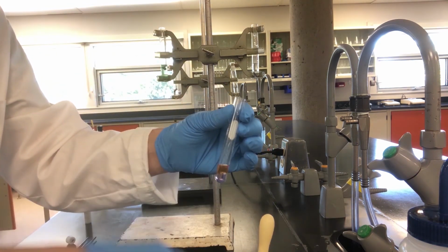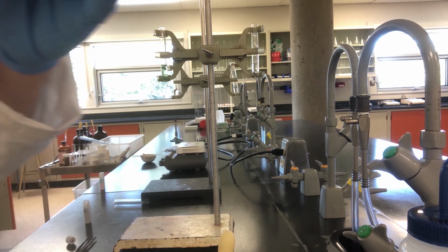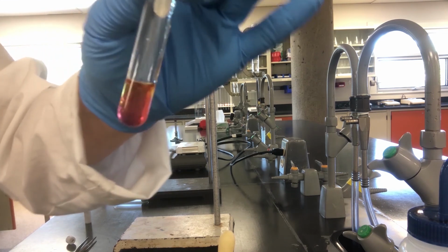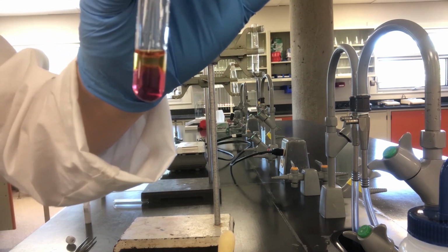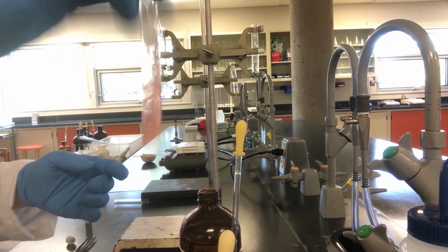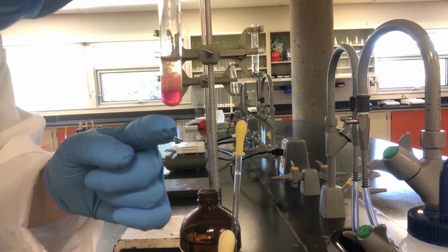First add iodine to the test tube, then dichloromethane. Cap, shake, and notice that the color is that of iodine in dichloromethane. Now, add the reactant, potassium chloride. Cap, then shake. Oh, the color remains the same. What can you conclude? Now you can answer the questions in your lab manual for this part of the experiment. To know the difference between an oxidizing agent, a reducing agent, and what element is oxidized and what element is reduced. What is the oxidizing agent?